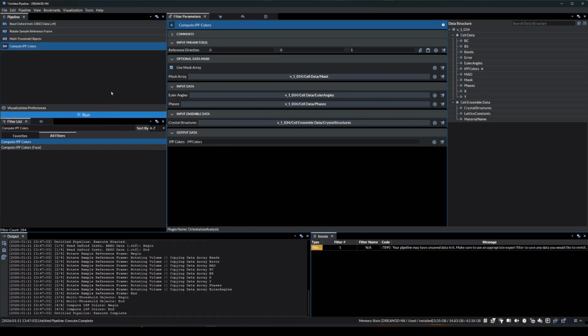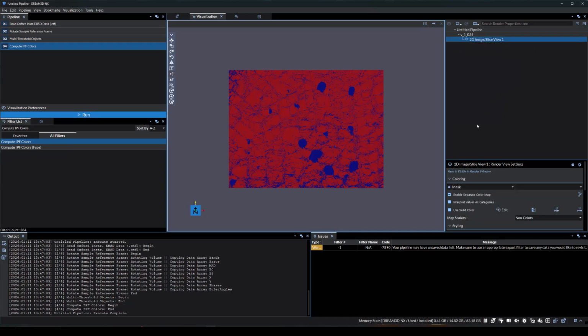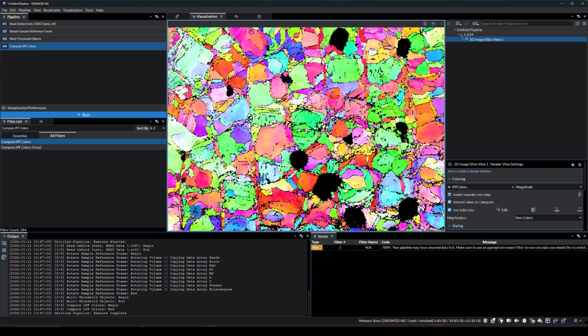Now we can run this pipeline and address the results. We'll switch the data view to 2D image slice and the color array to view the IPF colors object. Now we have an initial look at our data. Let's do some further filtering and processing.